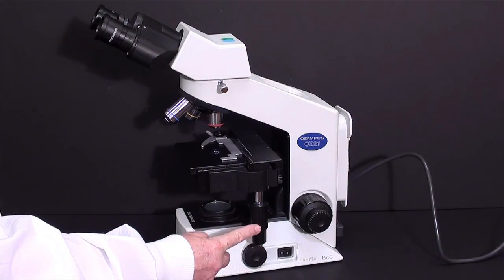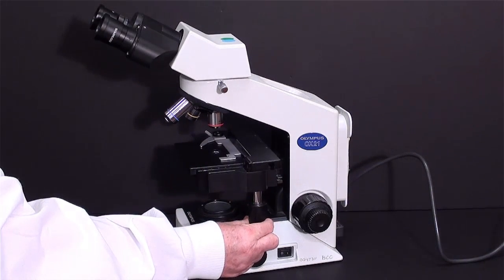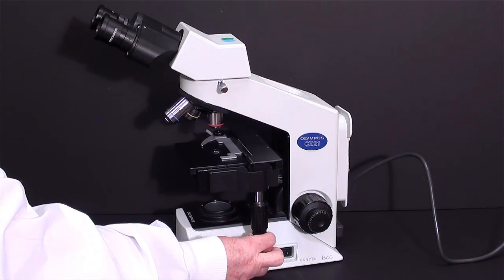This is the stage controls, allowing you to move the stage forward and back, and left and right.